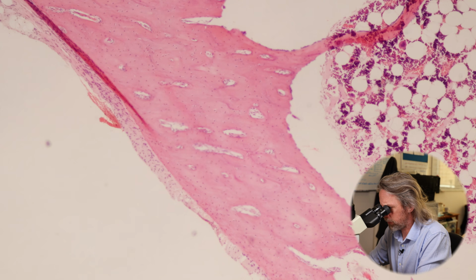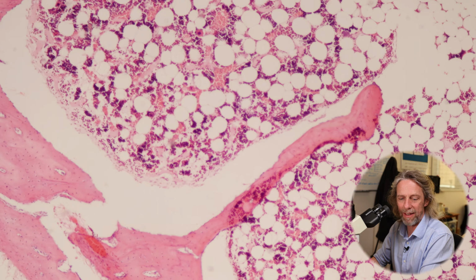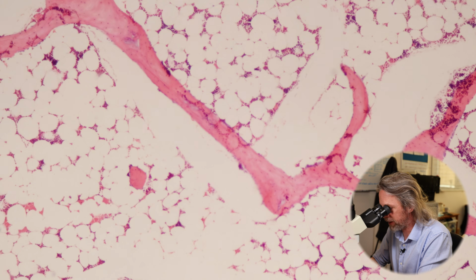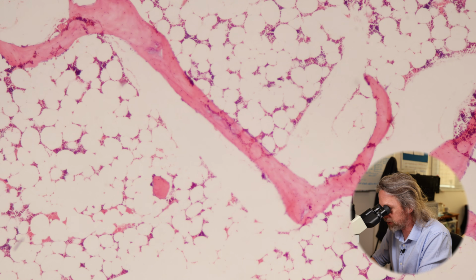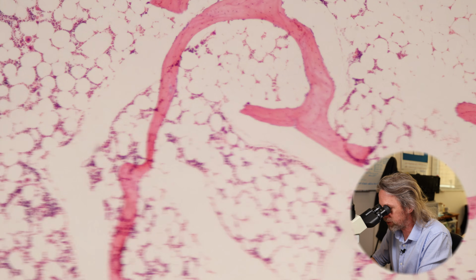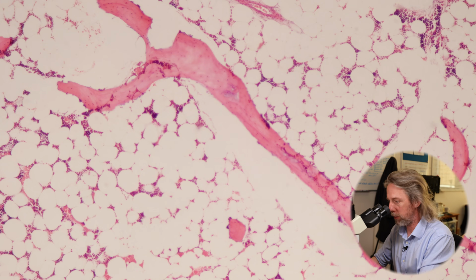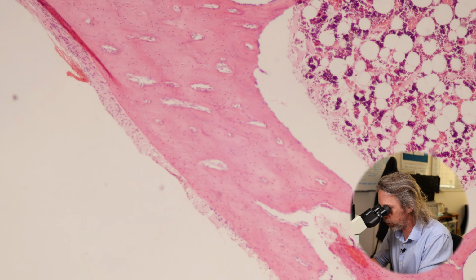And we can see then that there is the compact bone, the cortical bone. And we can see a little bit of structure here. It's got a pink stain. And then we can see these trabeculae, right? These spicules extending into the bone. And like I said, some of this stuff is moved around because when it's mineralized, it holds itself in place very, very well. But when we demineralize it and cut sections, well, the blade moves things around a bit. But I think you get the idea. So this is the trabecular bone. Spicules of bone, full of bone marrow. And out here, this is the compact bone, the cortical bone.